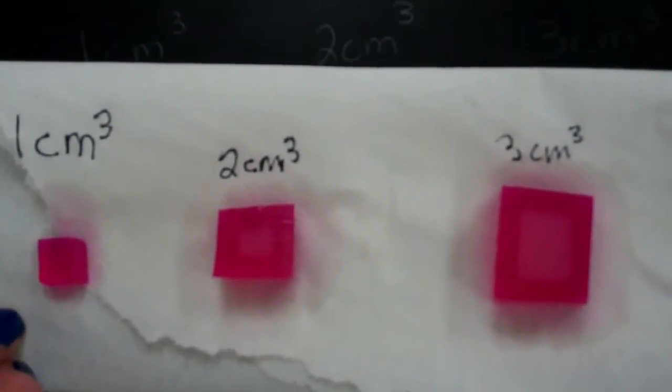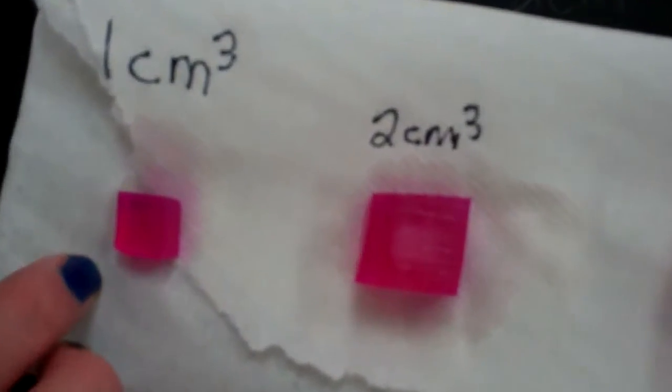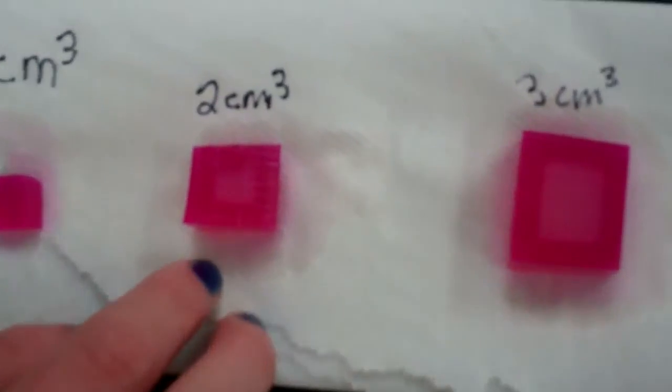The volume that is left over in the 1 centimeter cubed is 0, because all the nutrients, the NaOH, diffuse into the cube. The 2 centimeter cubed volume remaining is 1 centimeter cubed, and you can see the white part in the middle of the cube.